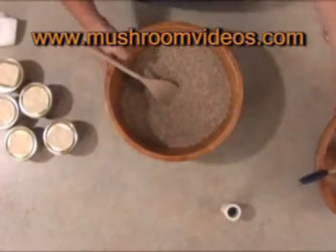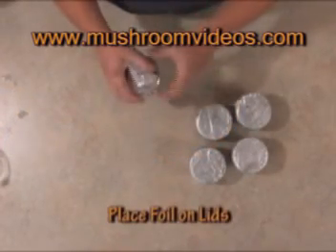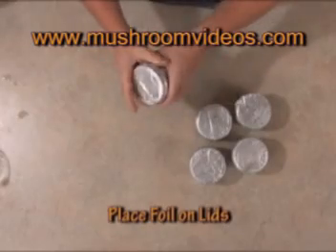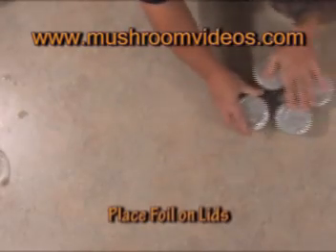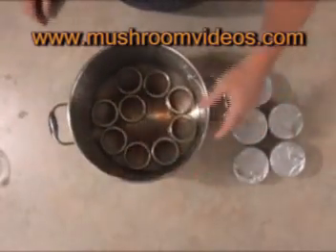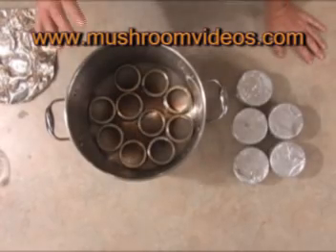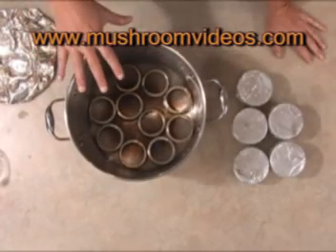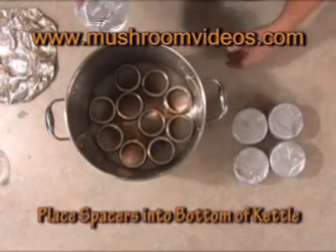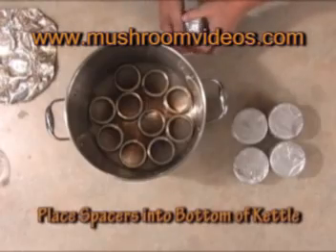We're going to go ahead and put the aluminum foil onto the jars now. I pre-formed them, and we can use that same foil over and over again. Here's your pan — I see we have a layer of jar lids in the bottom. What that does is it keeps the jars from being on the bottom of the pot. On one of the sites I teach on, a lot of people put a dish towel in the bottom with water and put their jars on top, but that's not a great method.